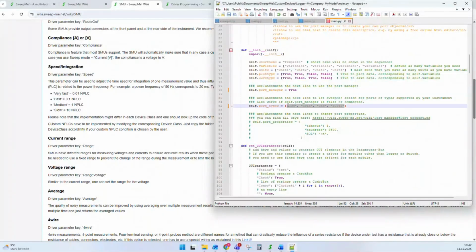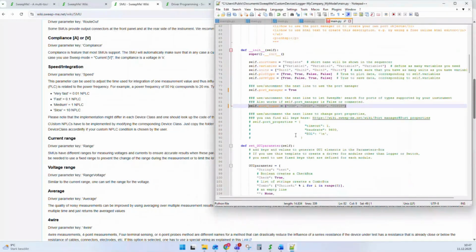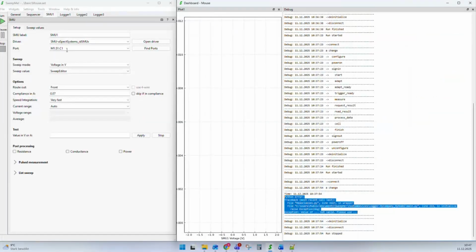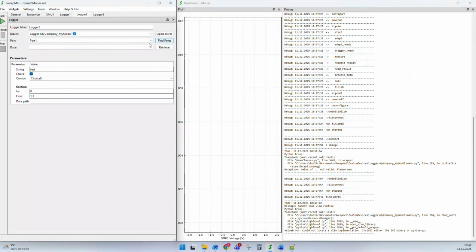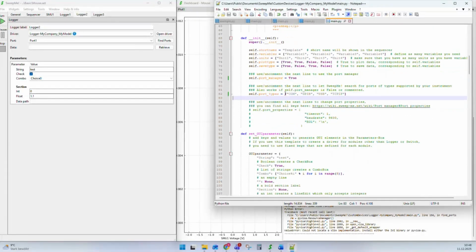If you have these standard ports, so you use the port manager, then you define the port types. If I now go to my driver, or let me first save this change. I go to my driver, my model, I use find ports, and we can see it found no ports. I think I have a problem here at my computer because I have just a new computer and Visa is not installed yet, so we didn't find any Visa related drivers here at this computer. But the idea is that SweepMe automatically finds all COM ports, all GPIB ports, all USB ports, and presents them in the port type fields. There's no further function that you have to write to find ports of these types.